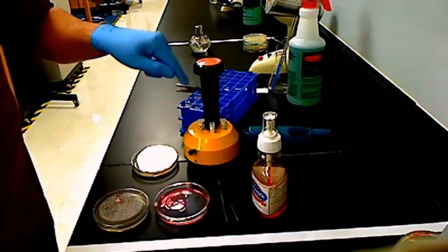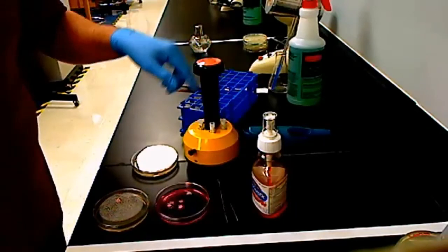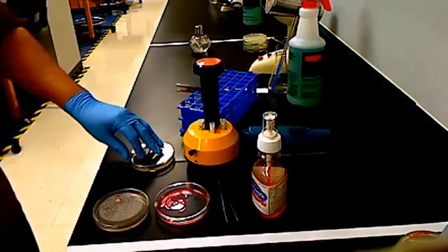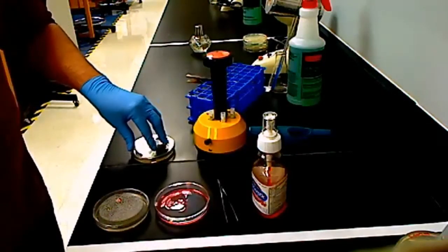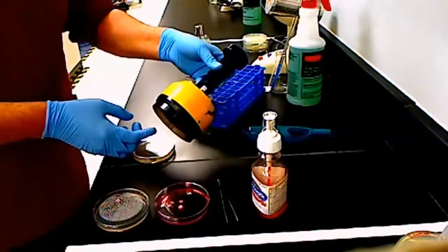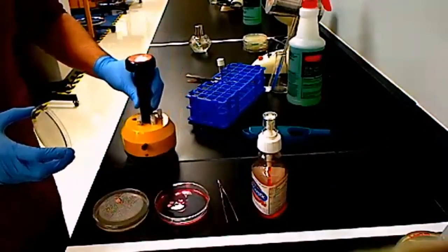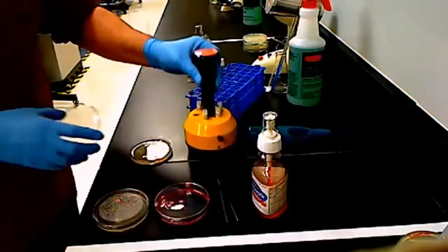Now, the antibiotics actually have little abbreviations as to what they are. So you don't have to write what's in which quadrant. But whenever you do the disinfectant lab, you will have to write down what's in each quadrant. Okay? So in order to do this part with the antibiotics lab, you need to take your plate, put it down, label side down, in front of the antibiotic dispenser. Okay, this dispenser has a little ring on the bottom, so it'll actually fit over your plate. But first you have to remove the lid of the plate. Then you're going to put the dispenser right over the top of your plate. You're going to push this down, let it come back up, okay, and then close your plate.